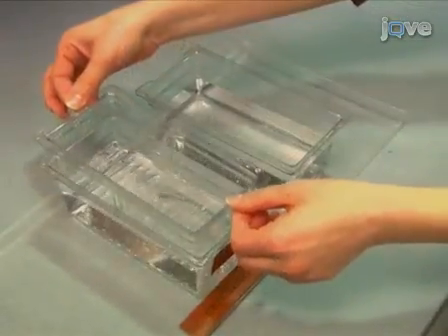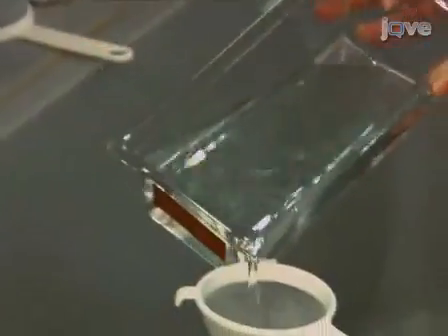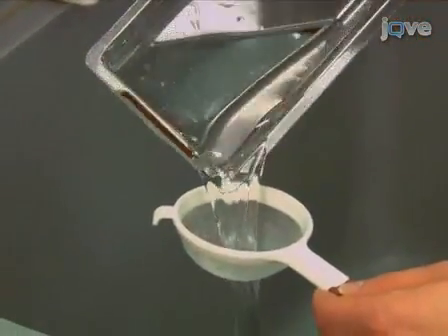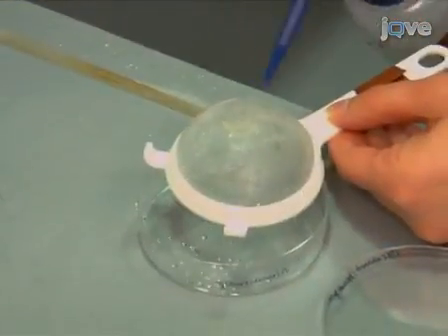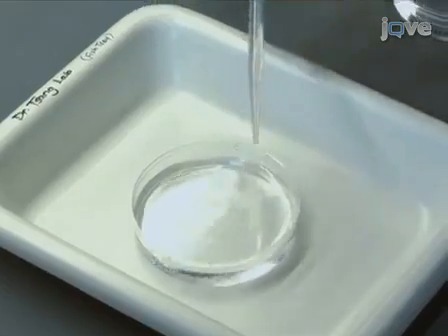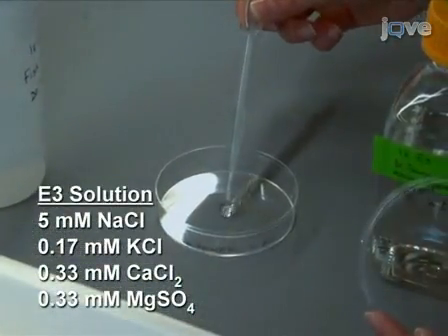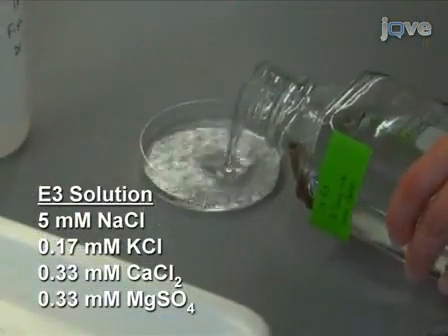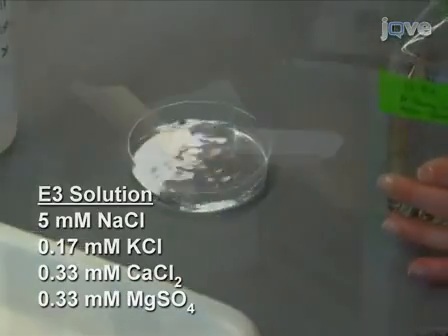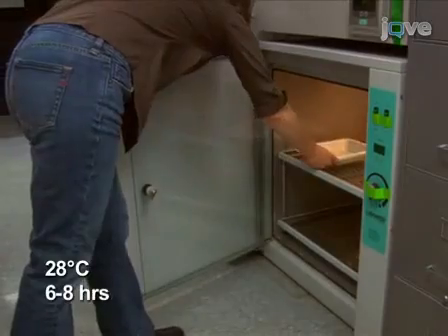After 1 hour, move the fish to a new tank and pour the embryos into a plastic sieve. Transfer the embryos to 100 mm dishes with E3 solution and incubate at 28 degrees Celsius for 6 to 8 hours.